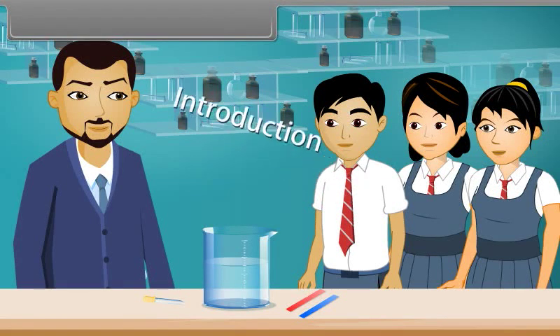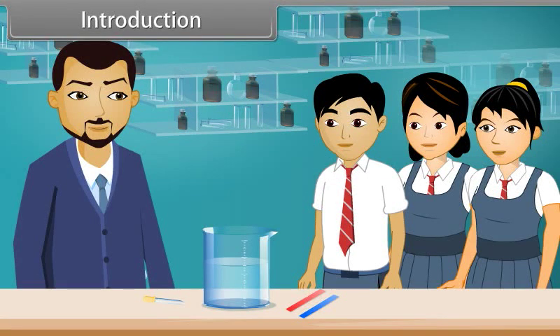Introduction. Hello students. Good morning, sir. Very good morning. Today we will perform an experiment to identify the acidic, basic or neutral solution.